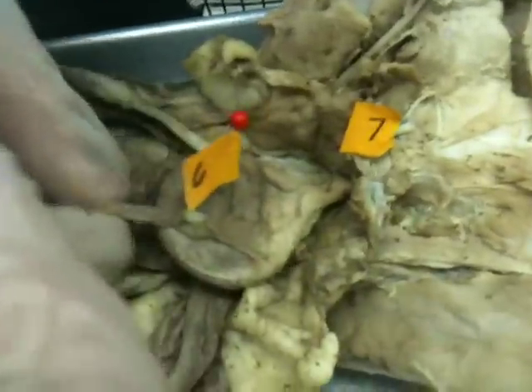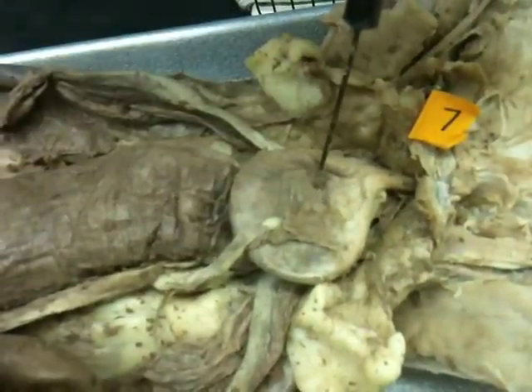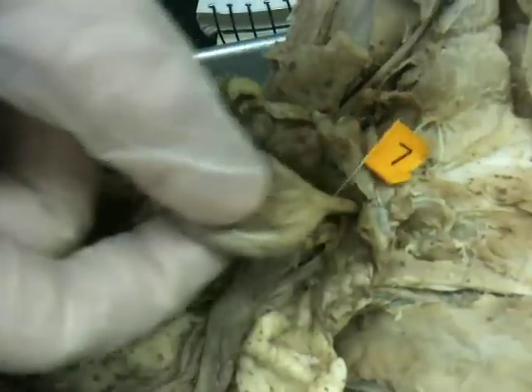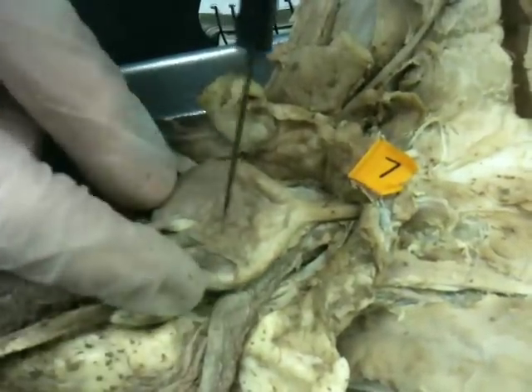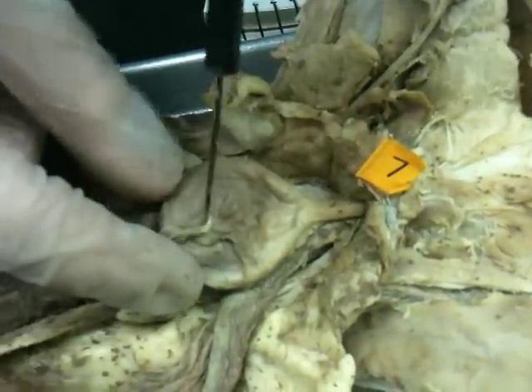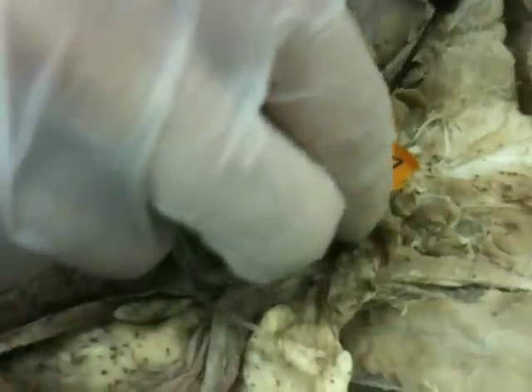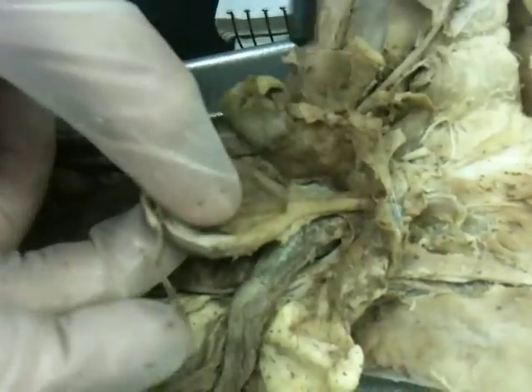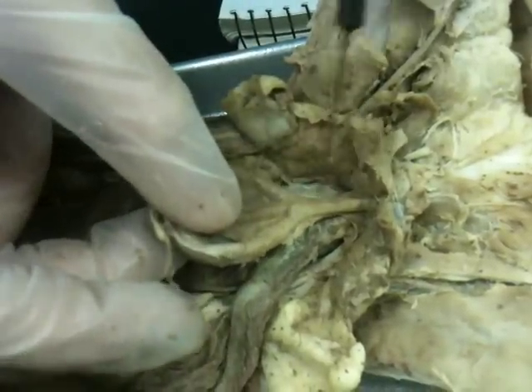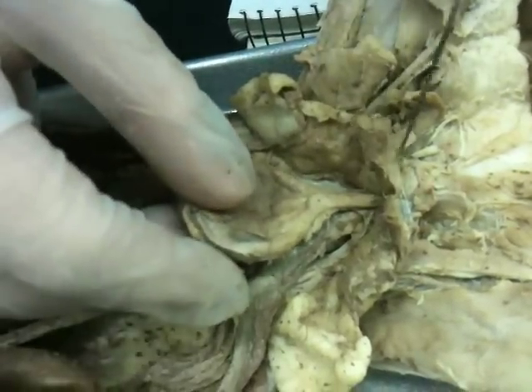We'll move into the bladder part. This is the urinary bladder found in both female and male, located right down here. Females are smaller than the males. This urinary bladder leads into the urethra, found in both females and males, which is just the tube that leads into the reproductive organ.